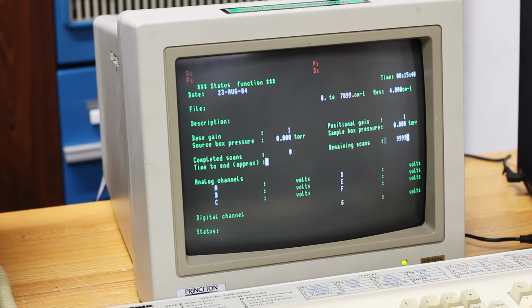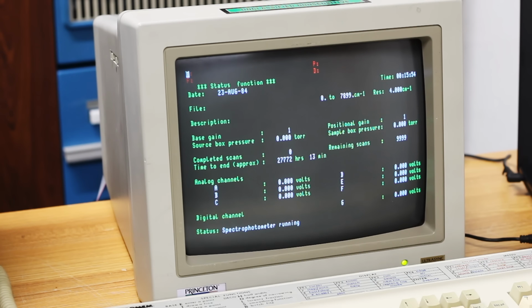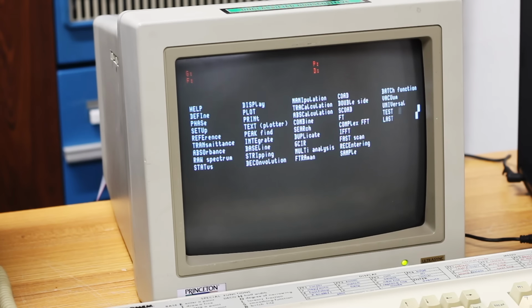I mean, I don't know what I was expecting it to tell me. I've been in this menu before and it looked all the same. All the analog channels were at 0. The digital channel was at 0. I don't know. Let's just fool around, see if we can get it to do something. All right, we'll do a Control Z to get out of that.